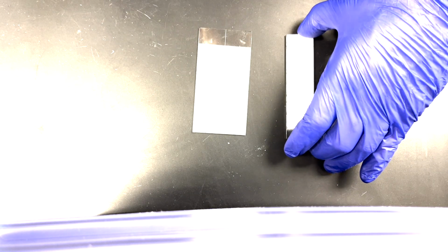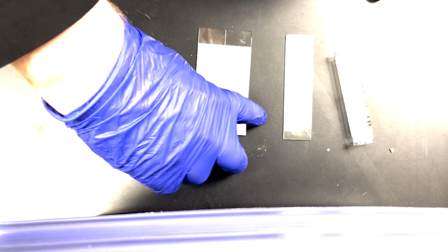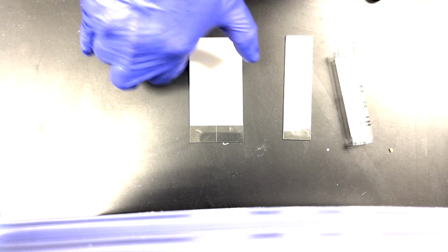Once you've got your chamber going, that's the first thing you want to do. Then you're going to get your plate ready. Now there are several different styles of plate that I'll show you. These are going to be the ones that we will likely be using in this lab. You can use a double to get twice the width there, as you've seen, or the single there.